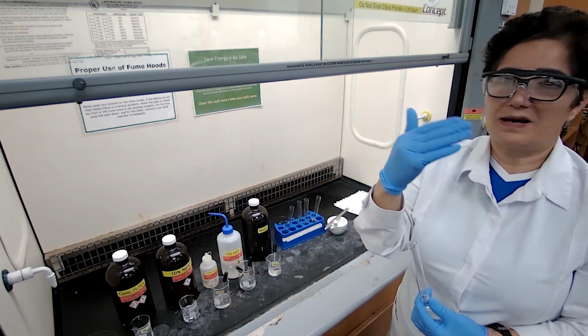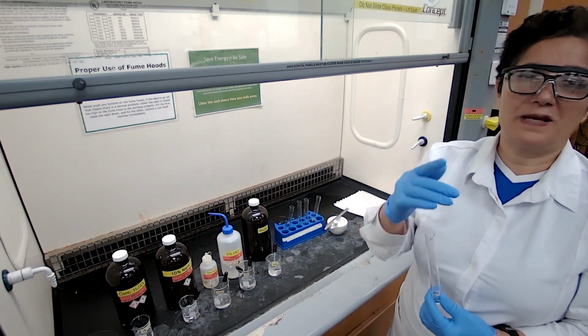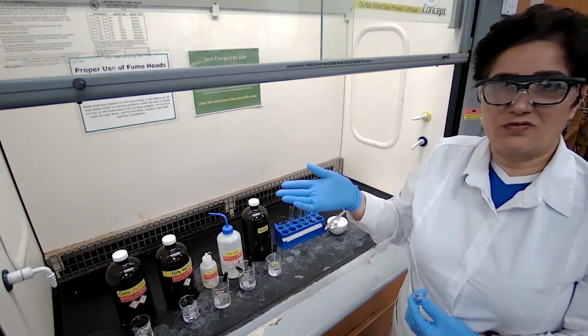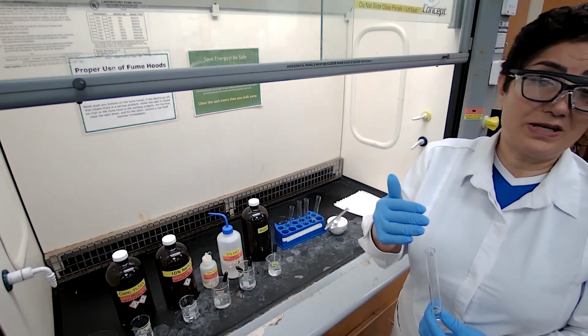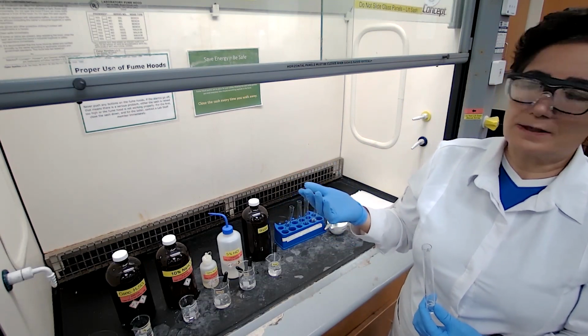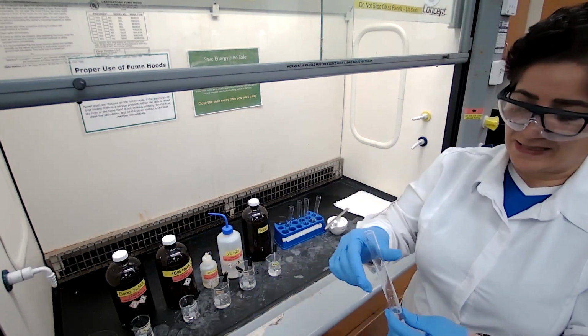A melting point around 153 or 154 doesn't help you to pick a single carboxylic acid. So we need a second piece of information. The second piece of information is going to be the molar mass for the carboxylic acid. No need to do the test for sulfuric acid.